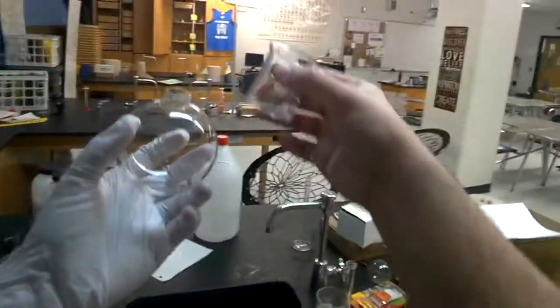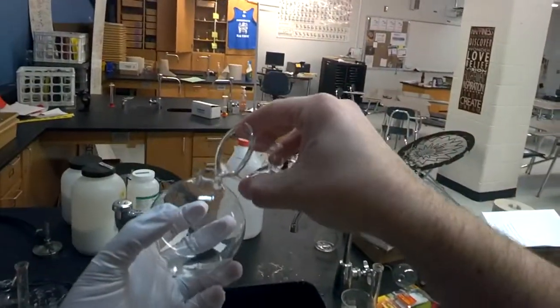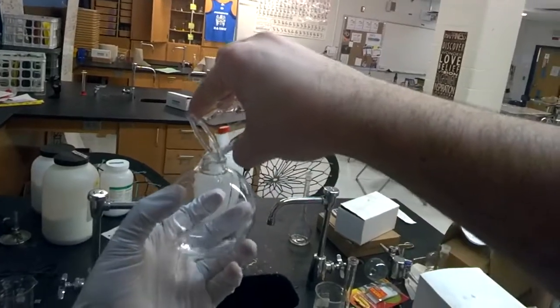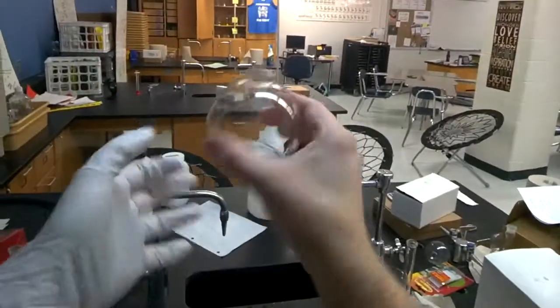So now I'm going to take my glass ornament and I'm going to add my ammonium nitrate and silver nitrate solution to it. And now when you do that you should not see any reaction.